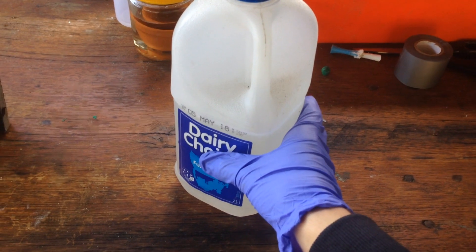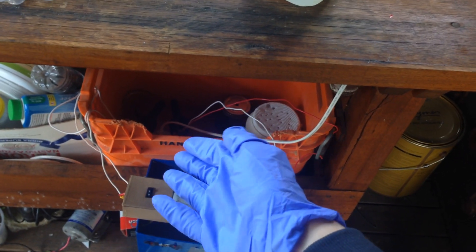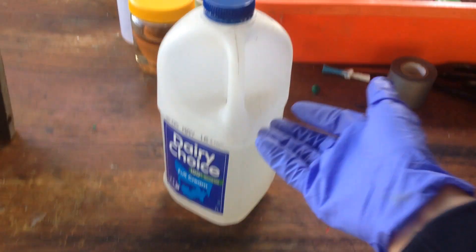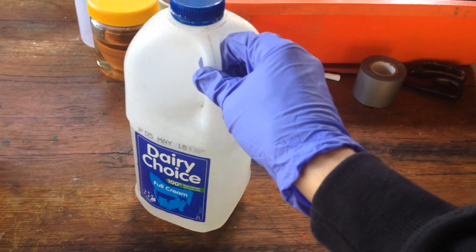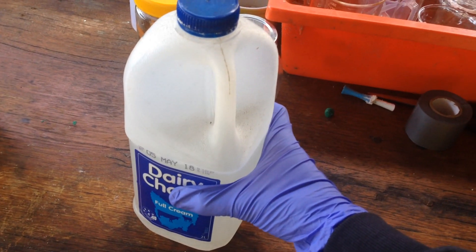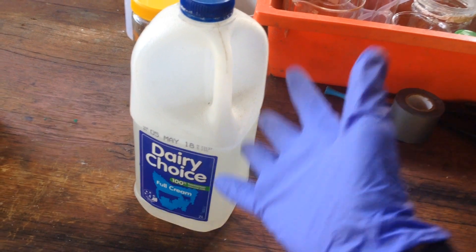Once this cell is done, this is going to generate another 200 millilitres of this 8 times concentrate, that we'll add to this, and we'll have 1.6 litres approximately of 8 times concentrate, which should contain, hopefully, if everything goes well, 2 millilitres worth of pure heavy water in there somewhere.